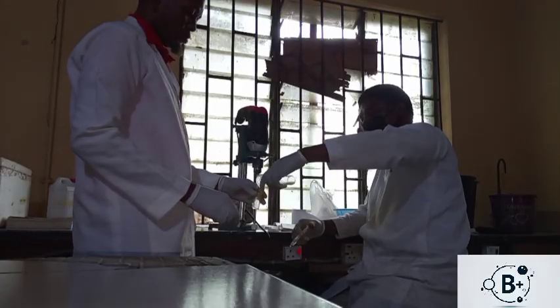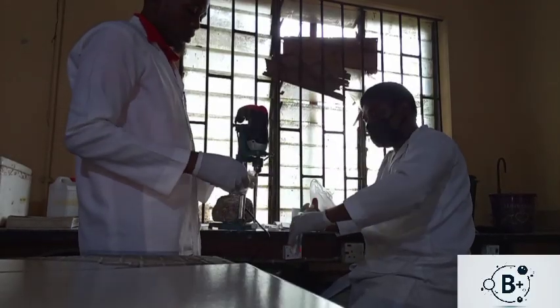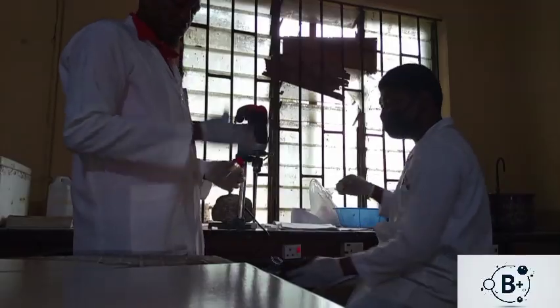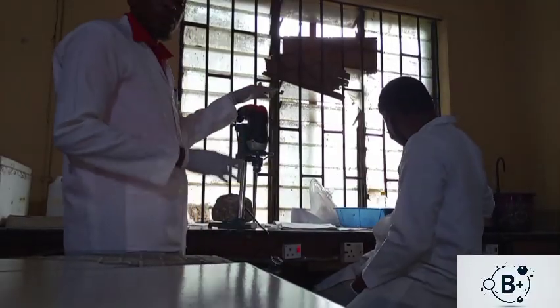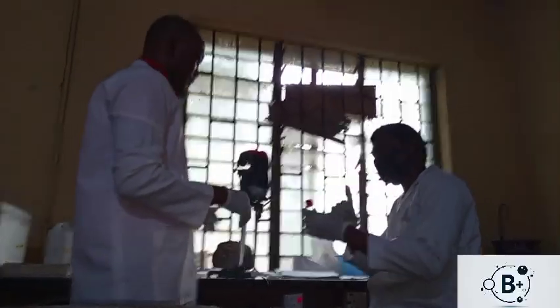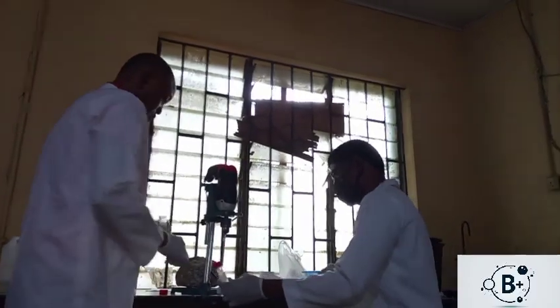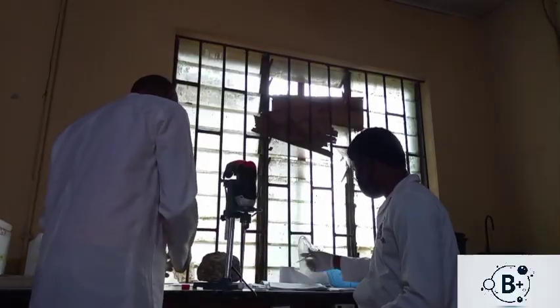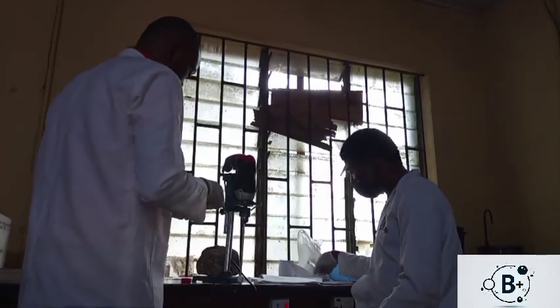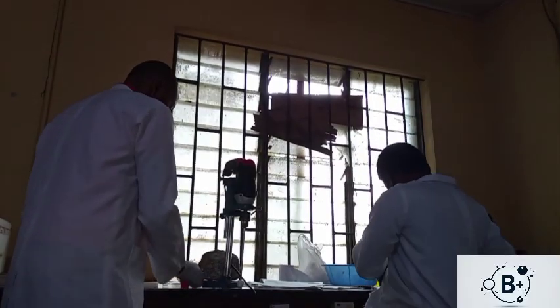So this process must be thorough, because the next step from here will be to take the homogenized mixtures to the centrifuging machine. They will separate the protein content from the rest of the tissue. So if the content is not homogeneous enough, then we may not be able to get the analysis done perfectly. So it's only right for us to homogenize correctly.